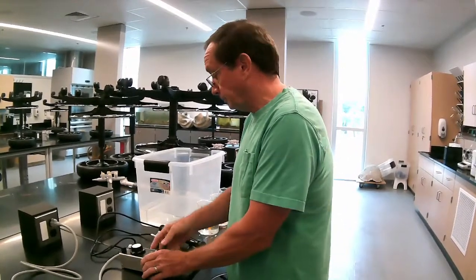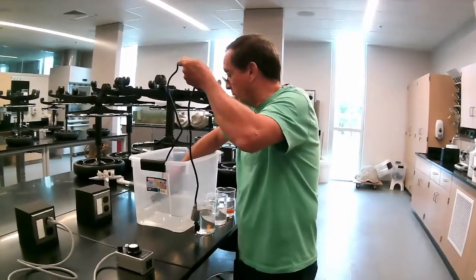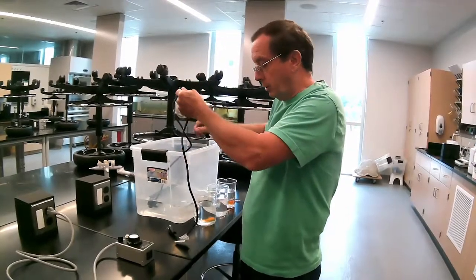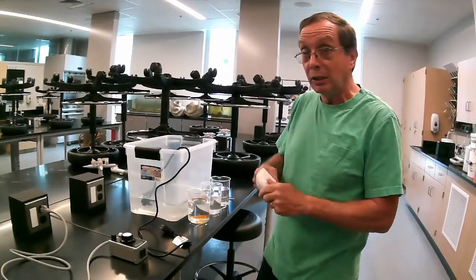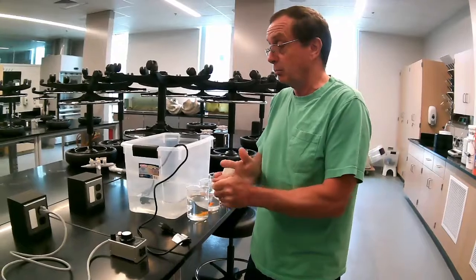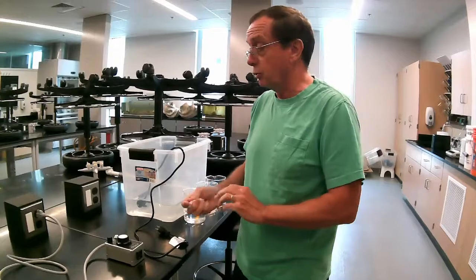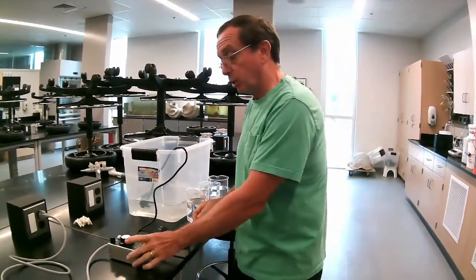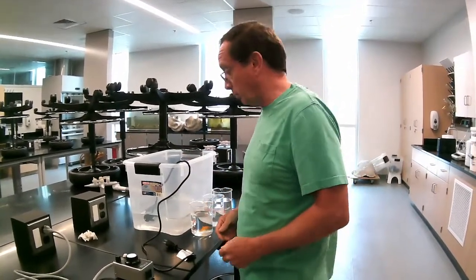Okay, so we're going to go ahead and put the titanium heater into the water bath. A couple of things about titanium heaters: you never take them out of the water while they're on, or even shortly after you've unplugged them, because they will burn themselves up. These heaters have no control on them. In other words, they will continue to heat up until the water is boiling in there like soup. That's why we plug it into the Glasscol, so that we can bleed the heat in a little bit at a time.